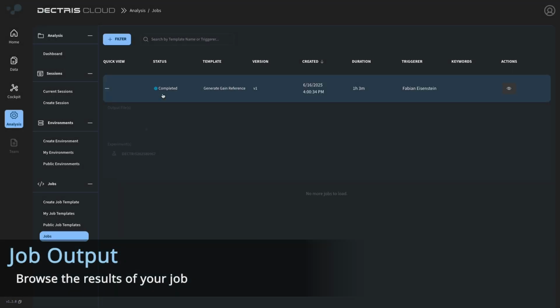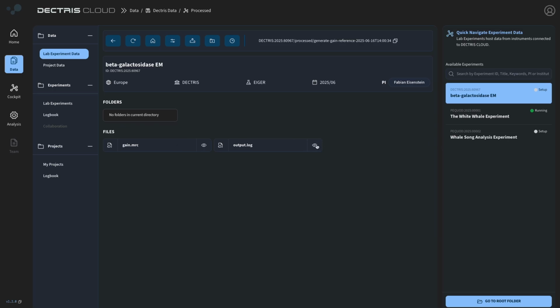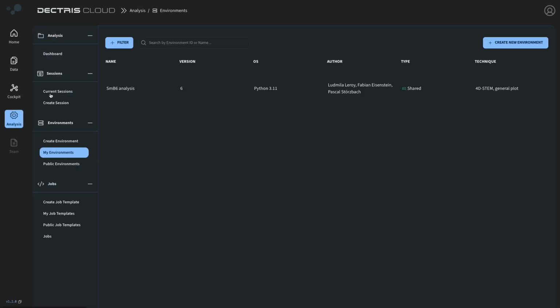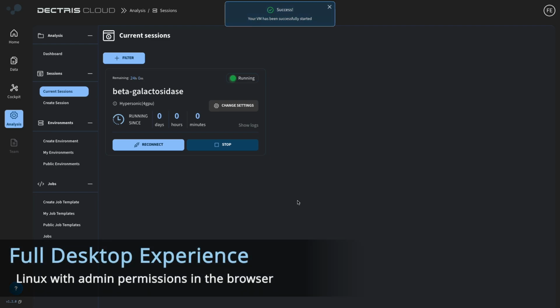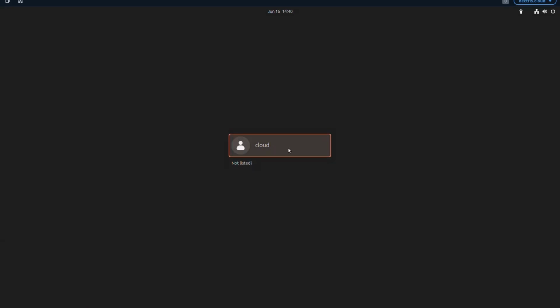Let's have a quick look at the job. It is completed. It produced a gain.mrc. If we go to the folder structure, we can see that there is also the output log. And now we can use this gain reference in our session. Once the session is running, we can simply click on Reconnect and it will open a new tab with our Ubuntu workspace.